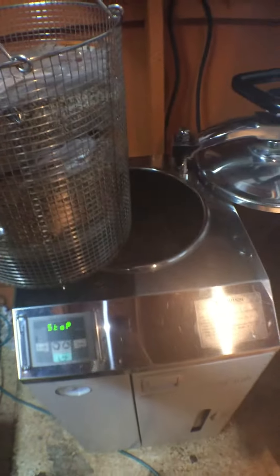It gets up to about 20 psi — here's the meter right there. It will take about 45 minutes to an hour to get up there. But once it is, it will automatically shut off at the designated time, which is an hour and 45 minutes for about 20 pounds of dried grain, which turns into a little under double. But yeah, this is a badass piece of equipment and one of the best pieces of our lab.